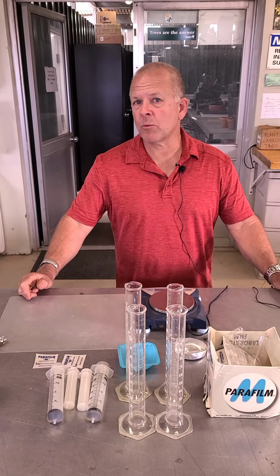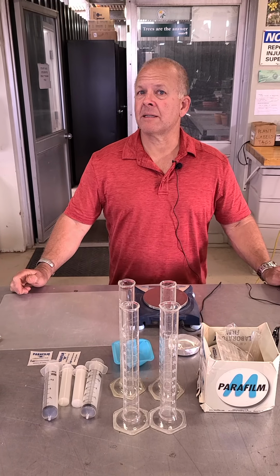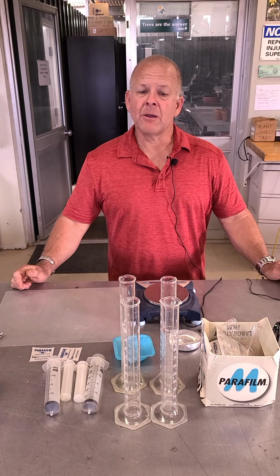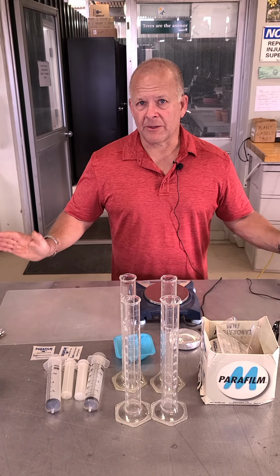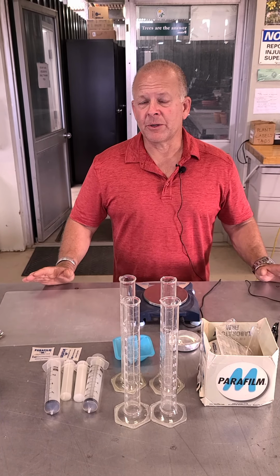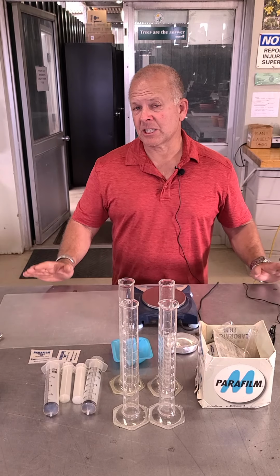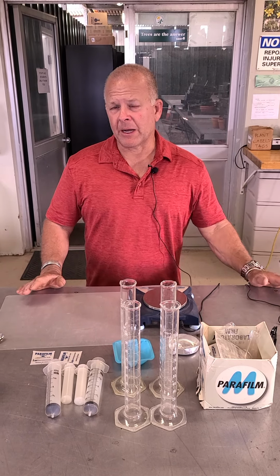This is AGNR 131 Soil Science Lab Exercise 3, Part 3, and we're going to talk about particle density today. We're going to do a little demonstration on particle density, and you'll notice I'll talk about it in a lecture, and also in your lab write-up or lab handout. There's a little bit more information on that.